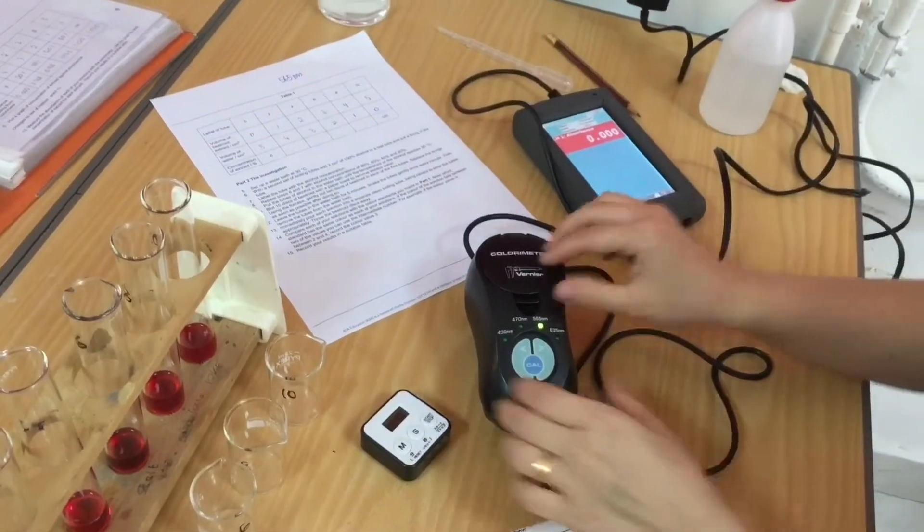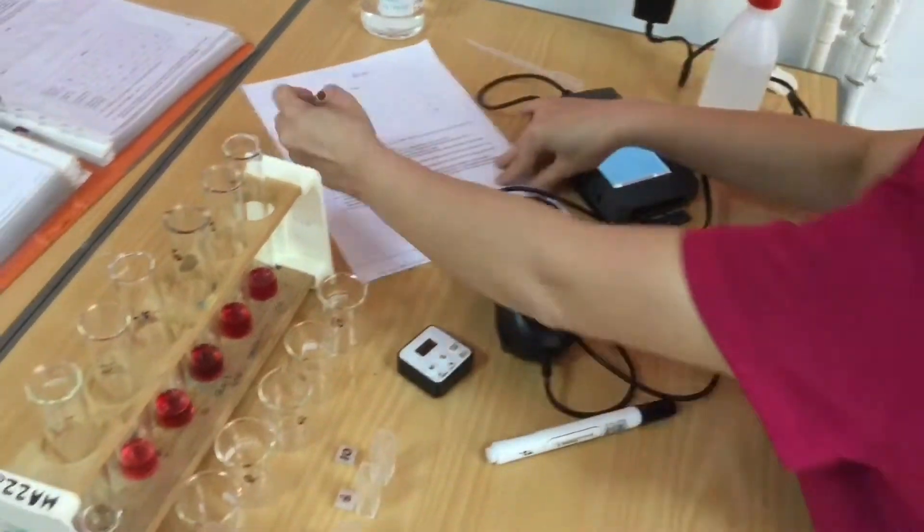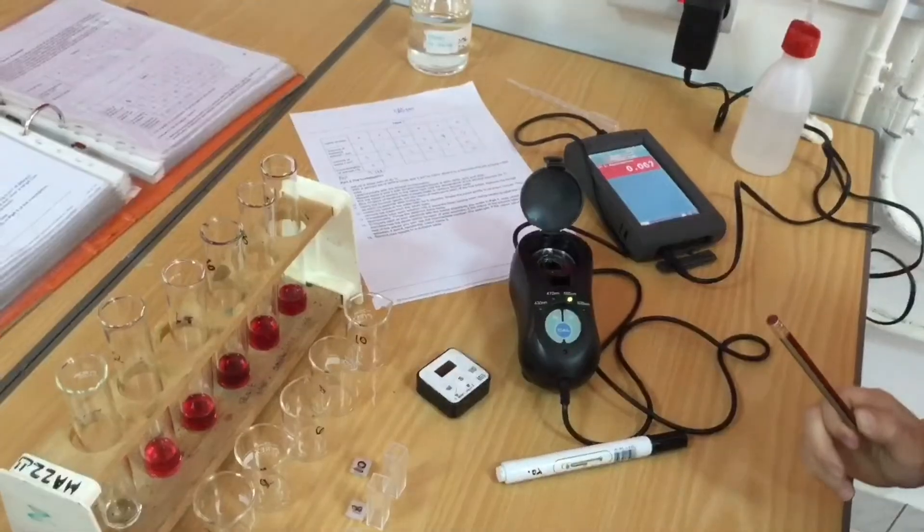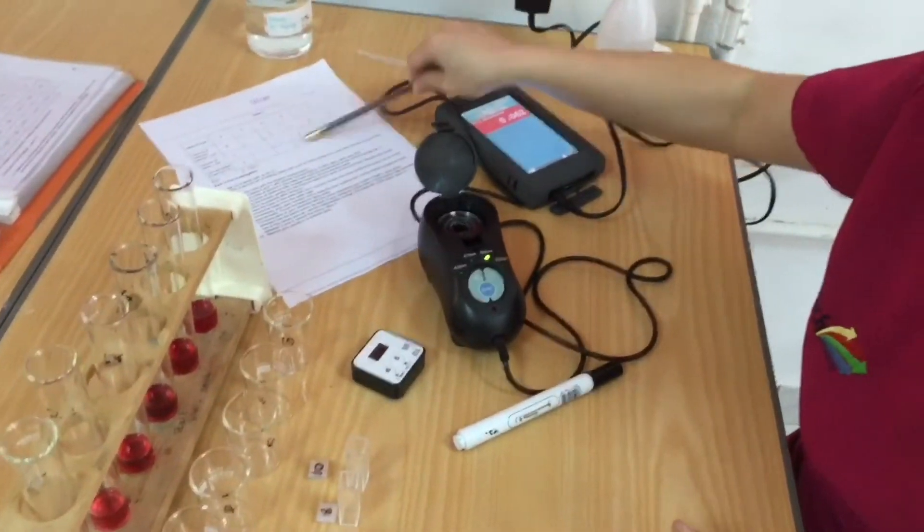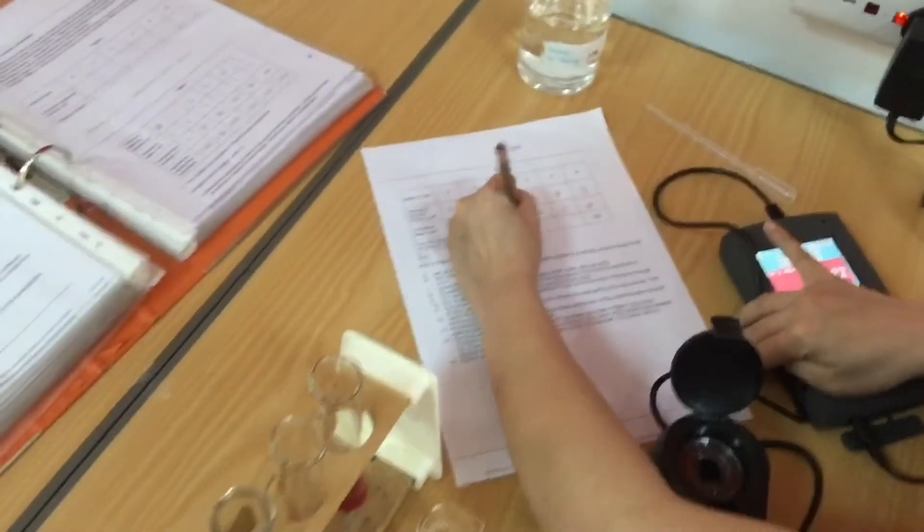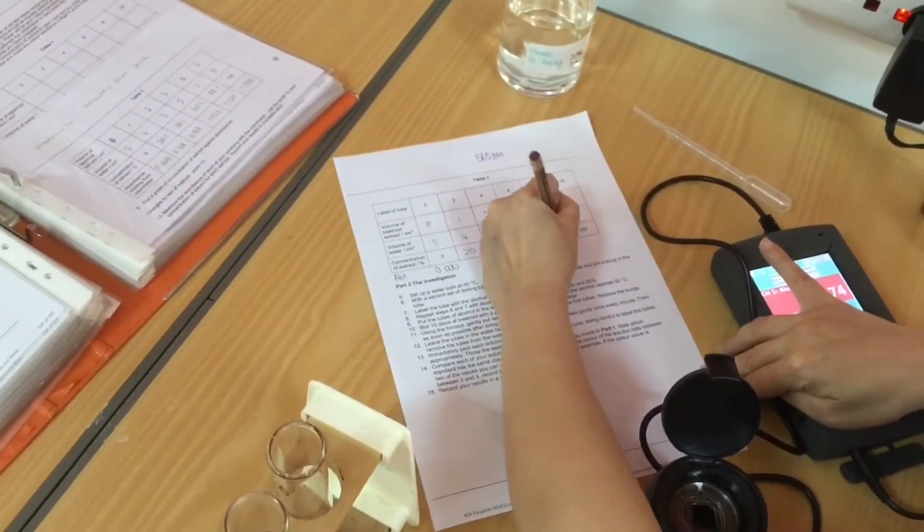I don't have to press anything at this point, but what you will see is that nothing changes because it's pure water, like when we just calibrated it. Back to zero. It's a little bit like when you stand on the scales, before you get on them you put them to zero, and that's exactly what that's done. And that first reading has just checked that.